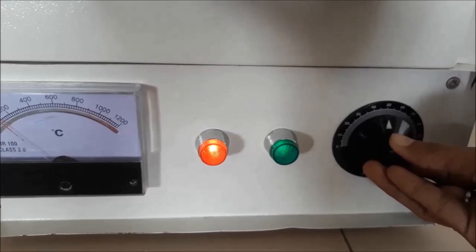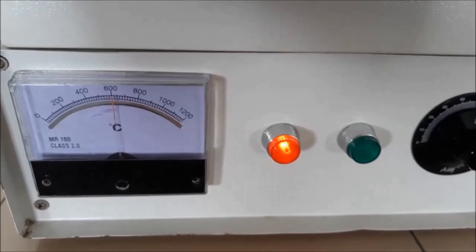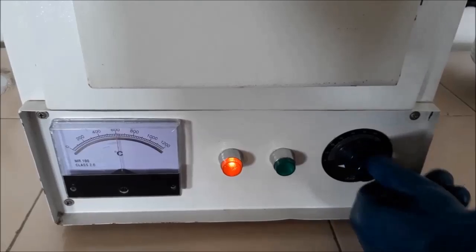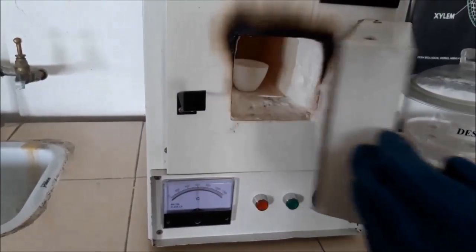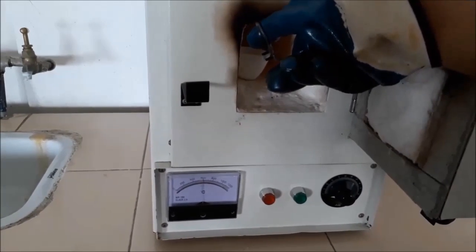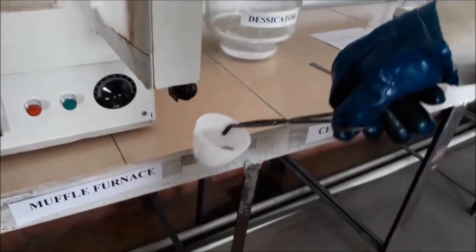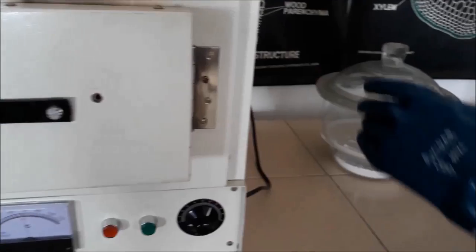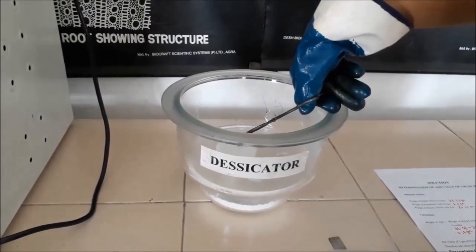Close the door of the muffle furnace and ignite it gradually by increasing the temperature to 500 to 600 degrees Celsius for about 2 to 3 hours until the ash becomes totally white. Now after 3 hours, take out the silica crucible.